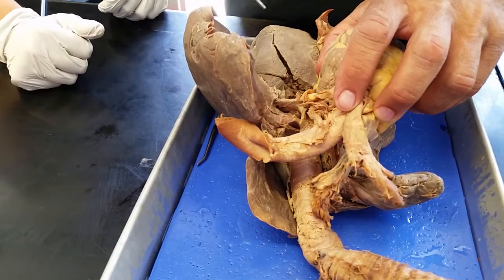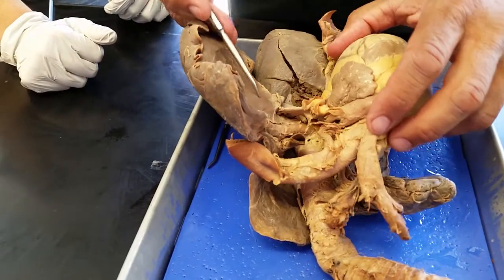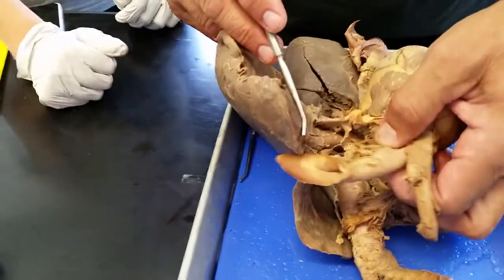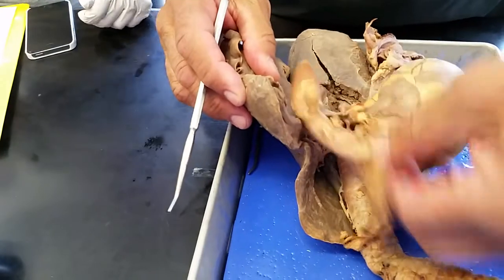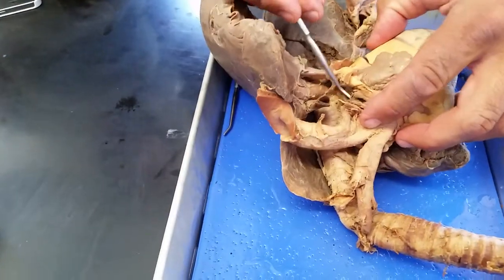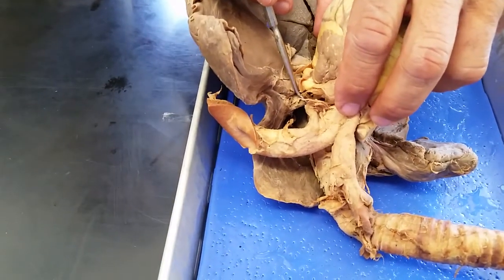Setup is on this cat. We don't need to know all this yet, but you will. This will be the aorta, brachiocephalic. So right here is the pulmonary trunk, which is hooked to this, making the pulmonary artery.